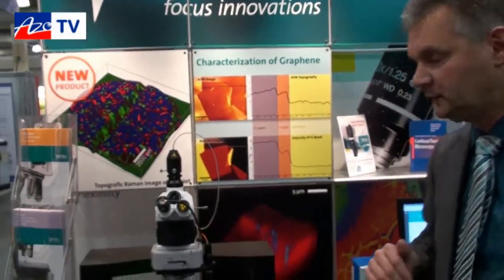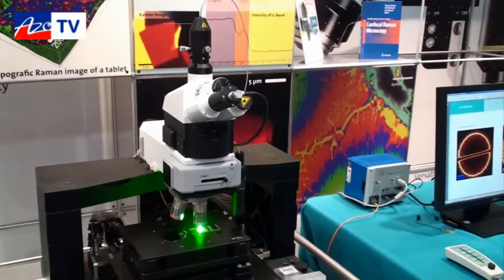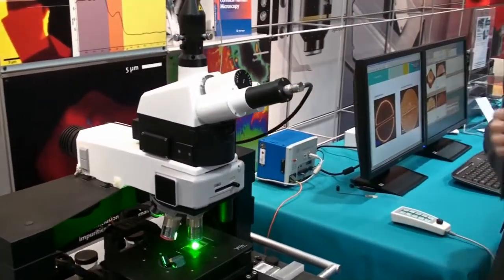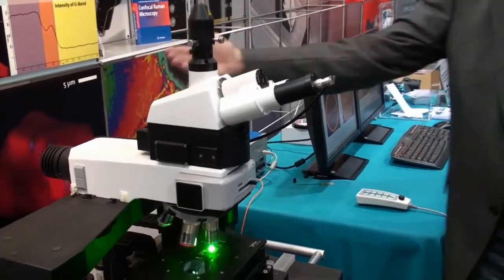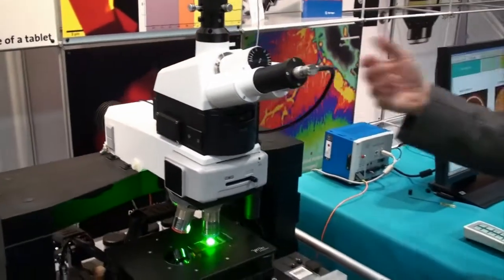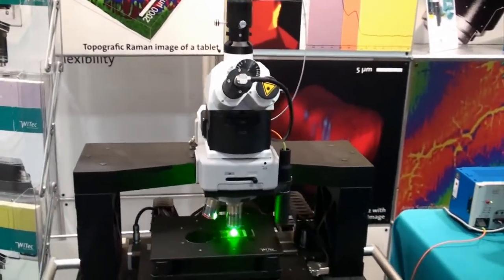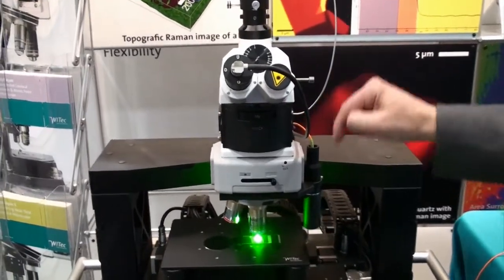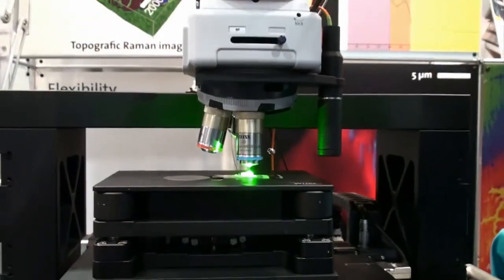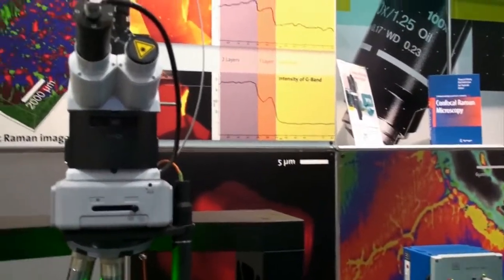I would like to show you the True Surface microscopy system which we introduced this year. This is our Raman system — it's a confocal Raman microscope. We have a laser source which is coupled into the microscope with a single mode optical fiber. The single mode optical fiber has a Gaussian beam profile which can be focused diffraction-limited onto the surface. The laser is focused onto the sample, collected with the same objective, and coupled into a fiber again, which is connected to a spectrometer with a CCD camera.